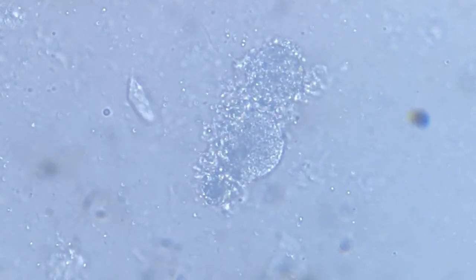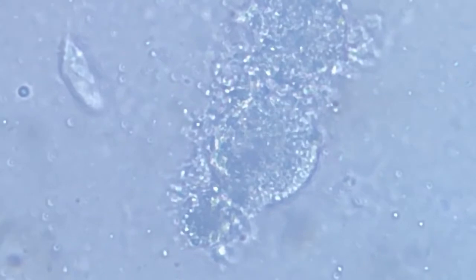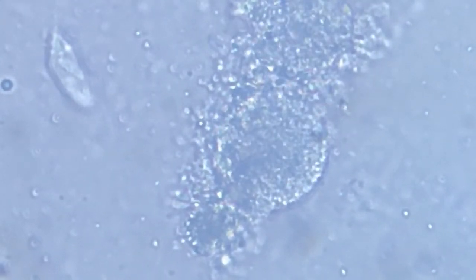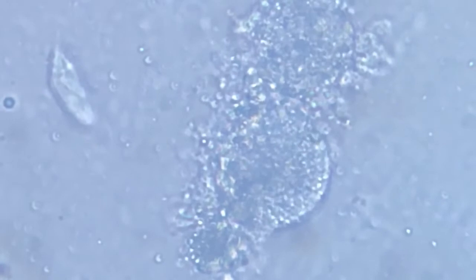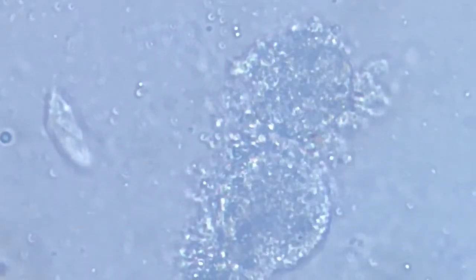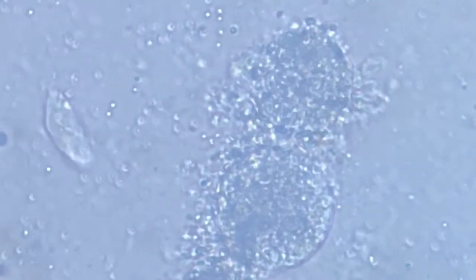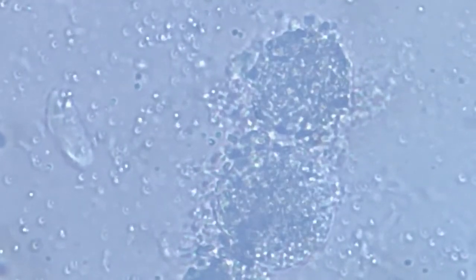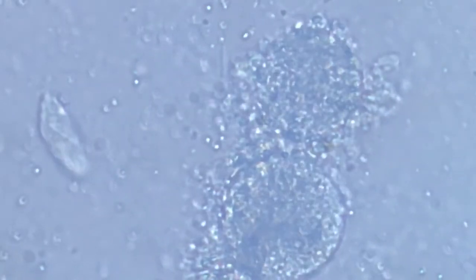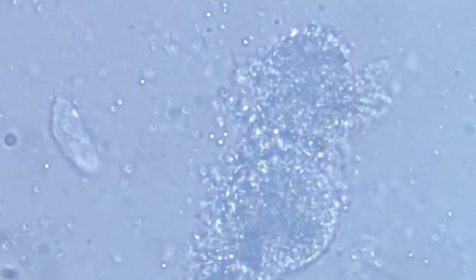Let's zoom in to see the frenzy. Nothing remains of the ciliate now in a live state other than these inclusions which have been liberated outside and are in a constant frenzied movement.